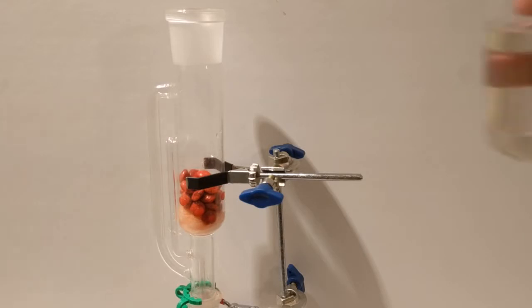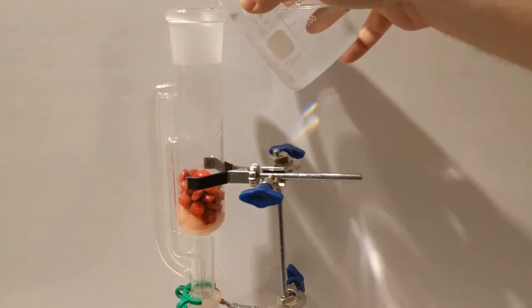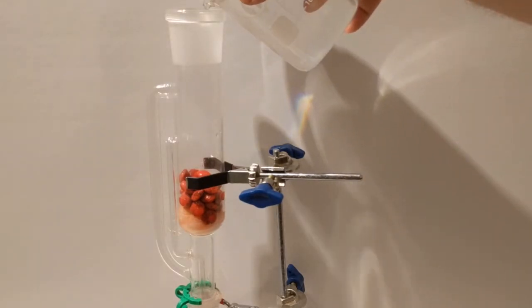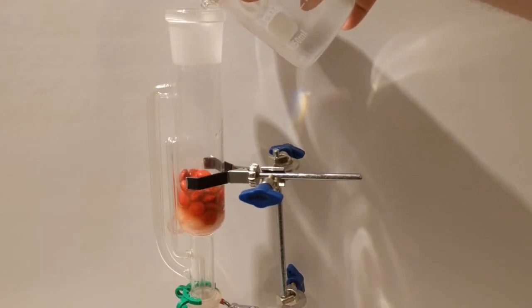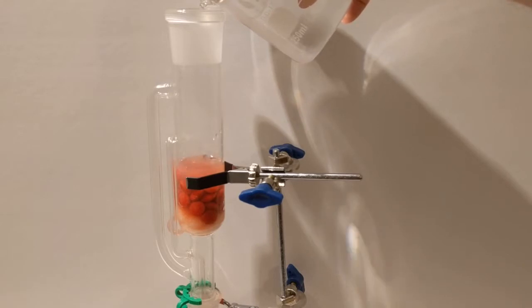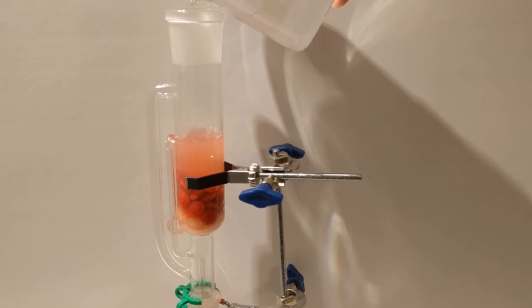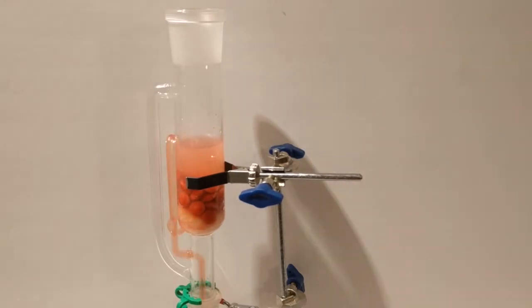So far, normal operation. What's different is this collection flask isn't heated in this case. Usually it would be heated, letting vapor go up through the big tube you see on the side and out of the top of the Soxhlet Extractor. Now let's watch the siphon operate one more time, just because it's cool.